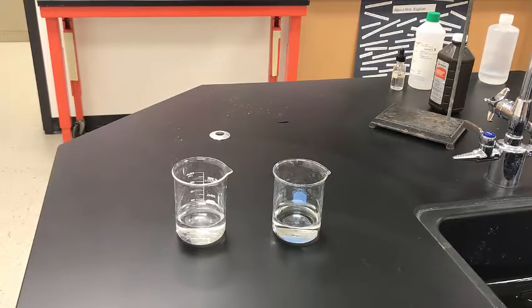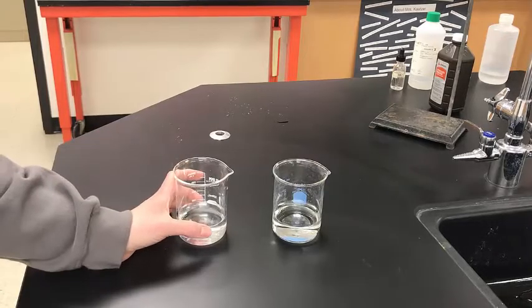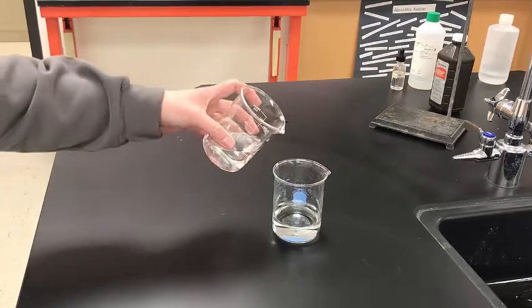Okay. Both of your reactants have partners, right? So think about that. They're not alone. They have a partner. Okay. So if you're going to record some observations, number 2 there, of your reactants, write down what they look like. Okay, for a procedure, I'm going to mix a small amount of hydrochloric acid with some sodium hydroxide and observe our reaction. Okay, since only one of these is done, we're going to do a bunch.